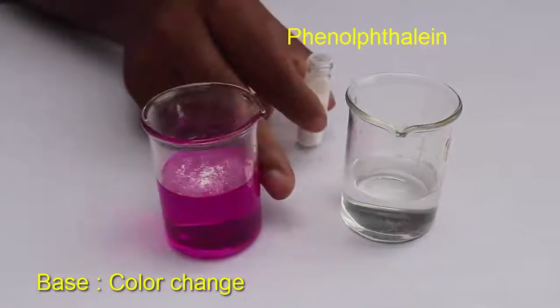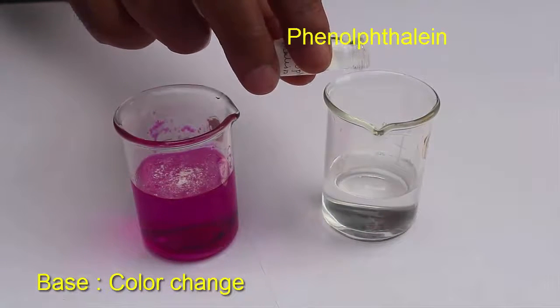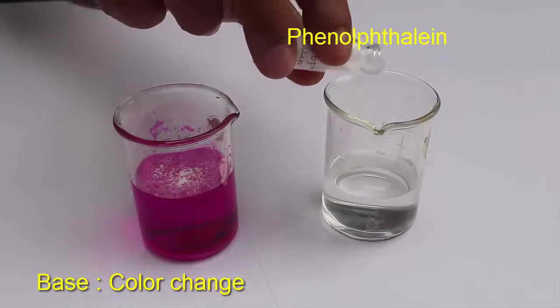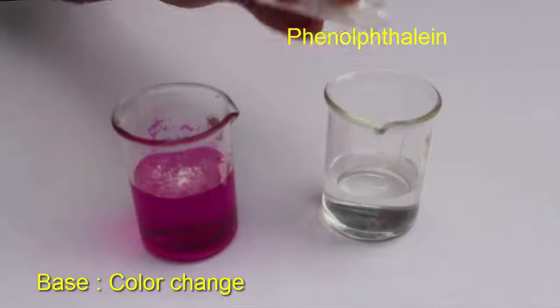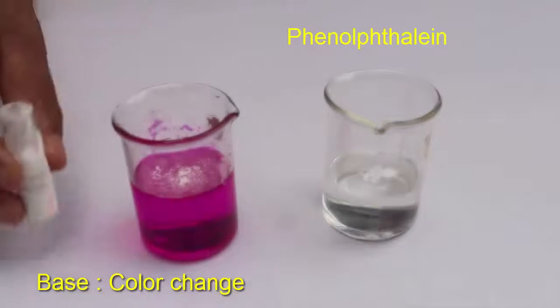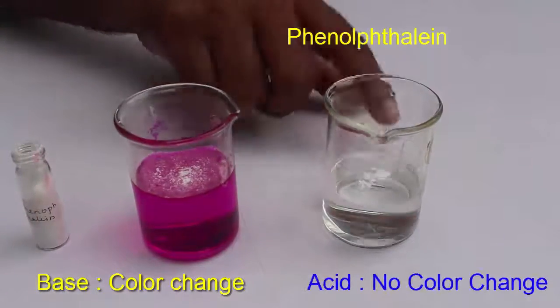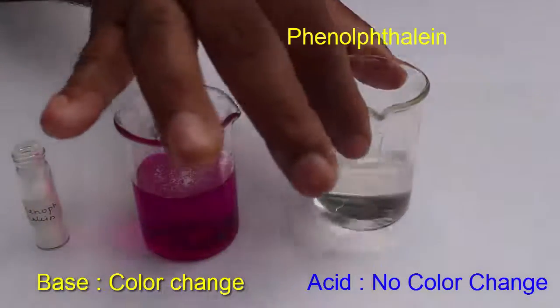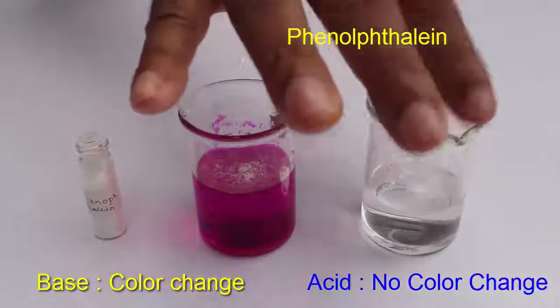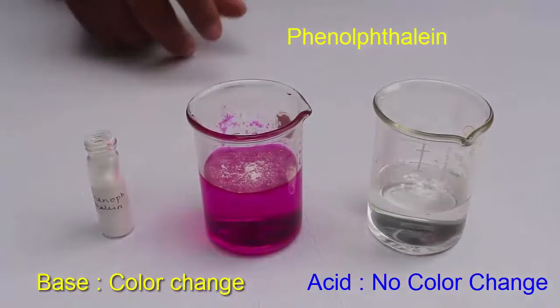Now we will add a bit of phenolphthalein powder to the second beaker. This time you will observe that there is no change in color. This means that the second solution was acidic in nature.